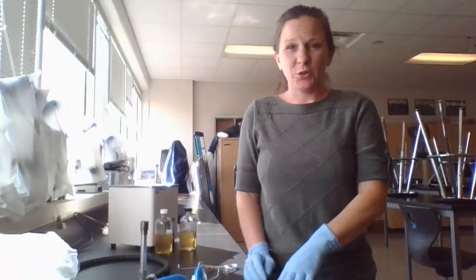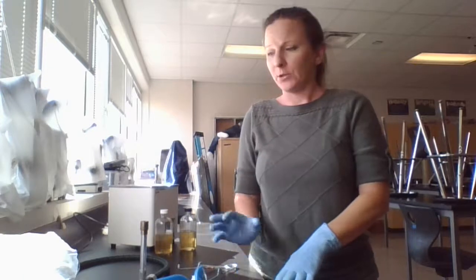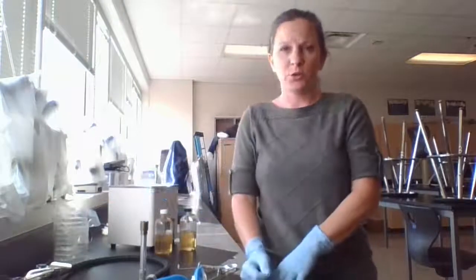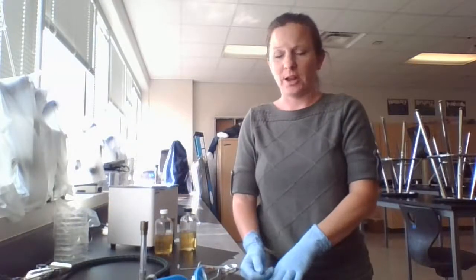All right, hey there. We're back again. So today I'm going to show you just a few things. First, I'm going to show you how to properly light a Bunsen burner. I'm also going to show you how to finish pouring those nutrient agar plates.